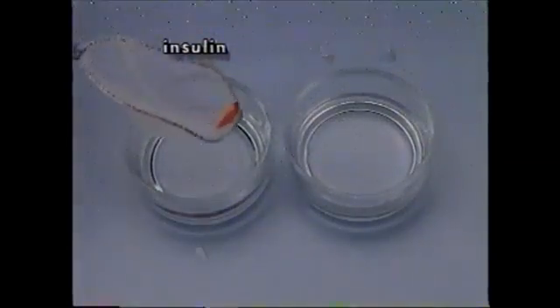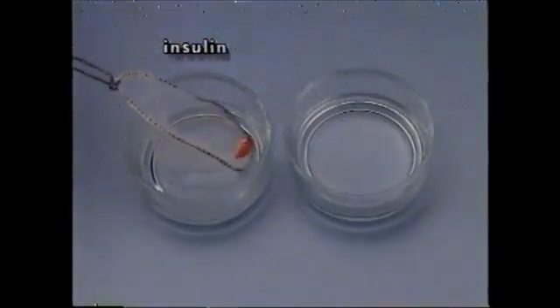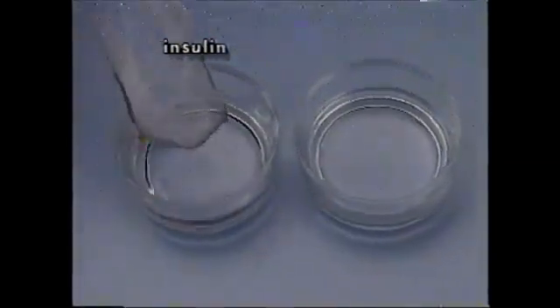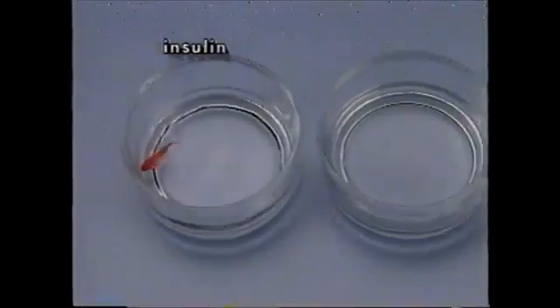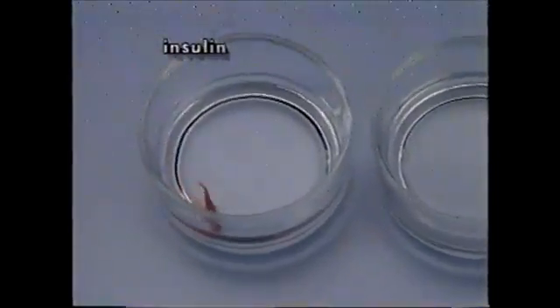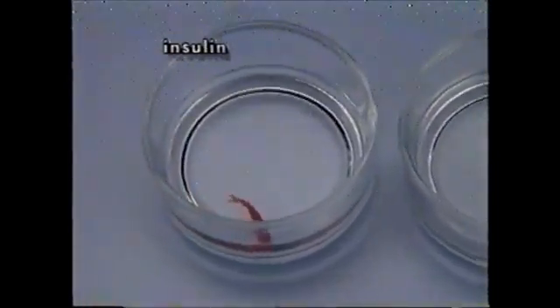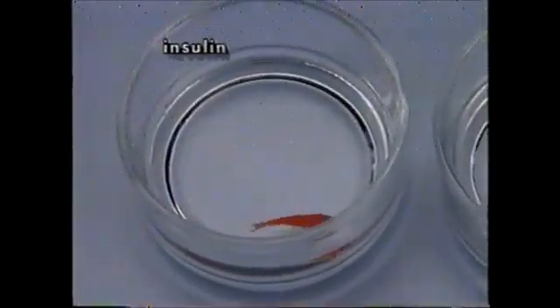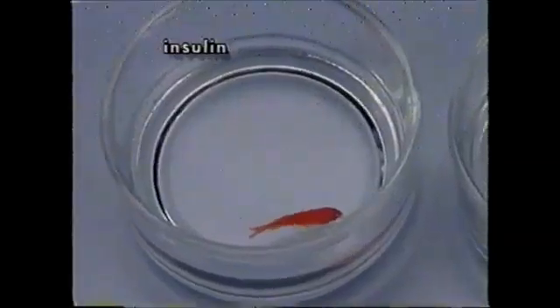A small goldfish is placed in bowl A containing insulin for observation of changes in behavior over time. Insulin is taken up rapidly across the gills to create a state of hyperinsulinism.